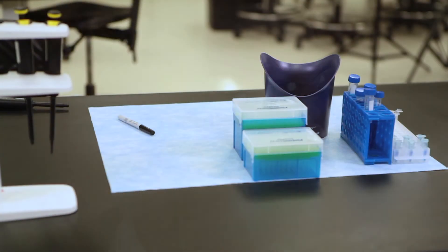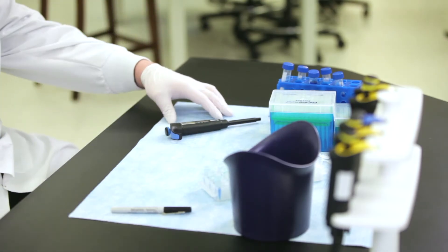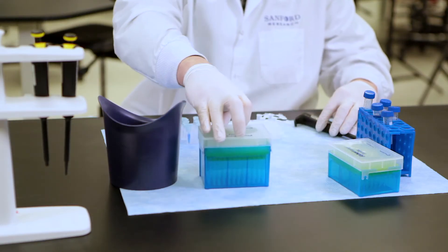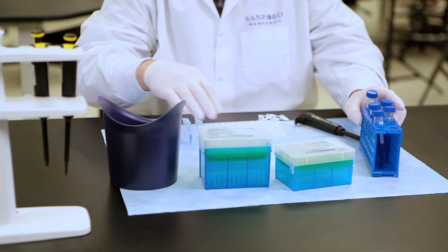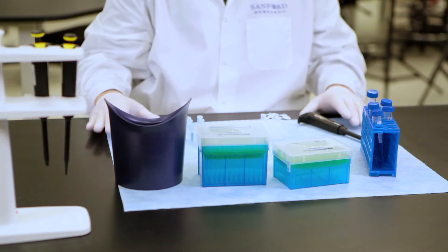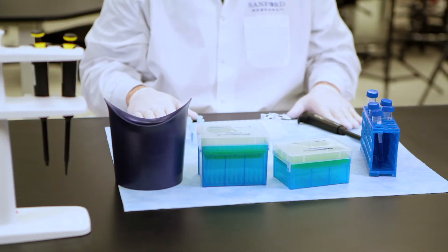Next, look at your lab space. In addition to PPE, it is important to set up your lab space so that all samples and containers are within your arm's reach. Also, clean your space and clear it of unnecessary items. Make sure you have appropriate waste containers for your used tips and arrange your workstation so you don't have to reach over your samples.